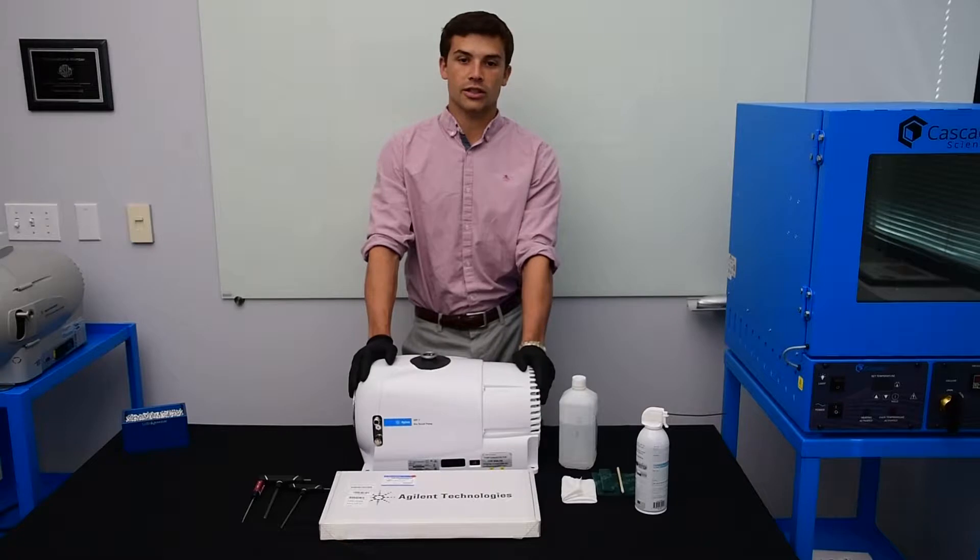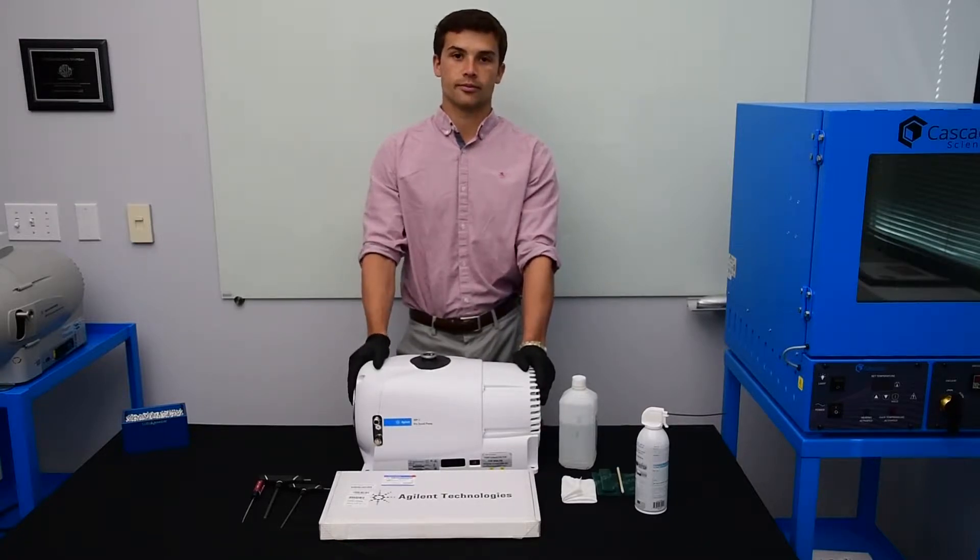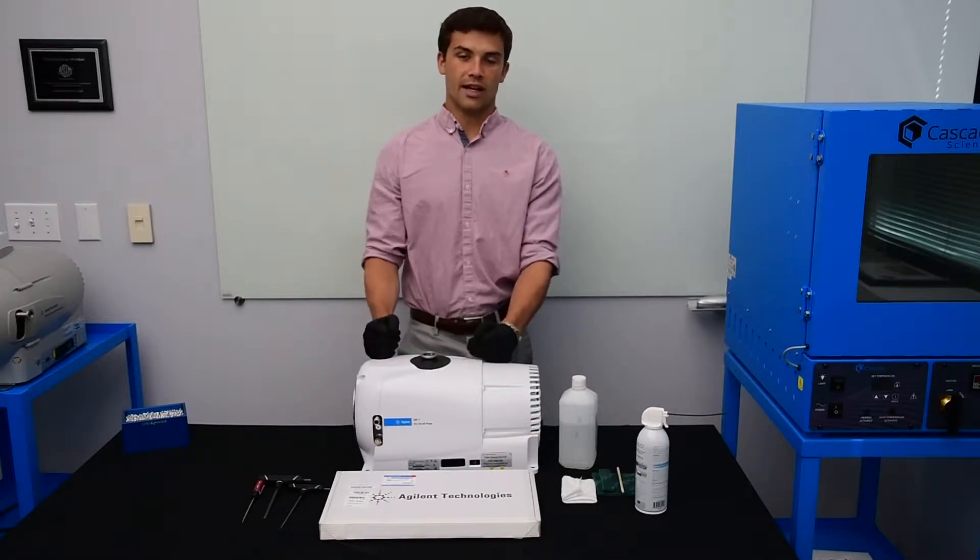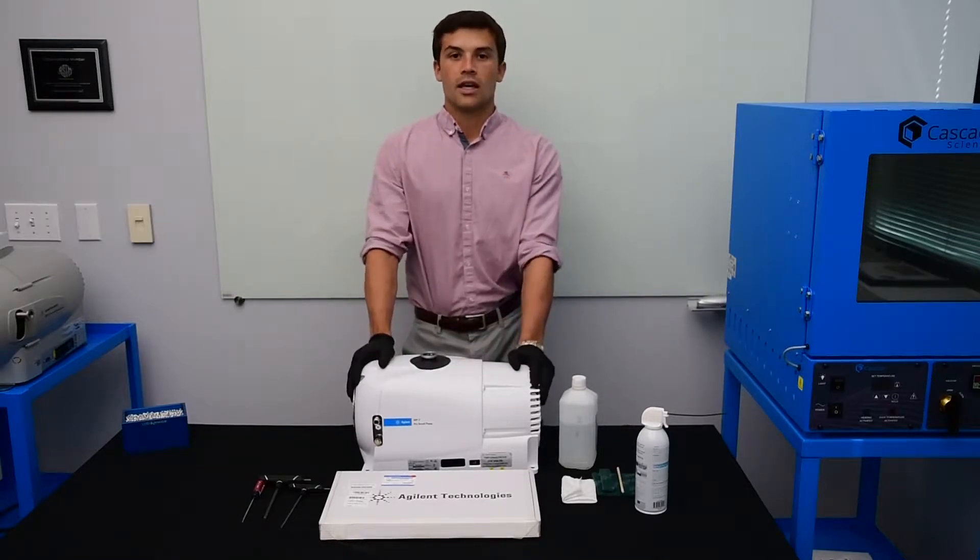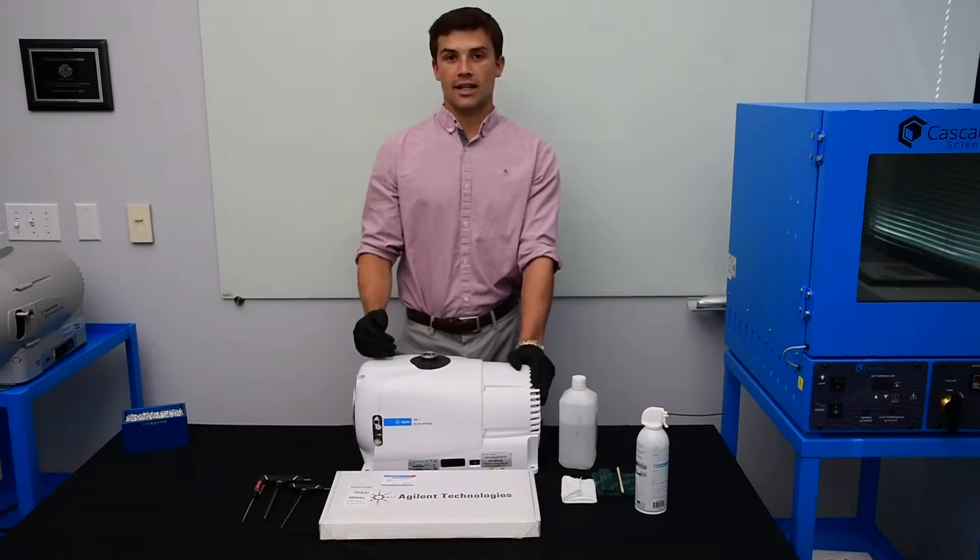In purge oven applications, you're going to get buildup or residue in your scroll pump. It's necessary to take a pump offline for a brief amount of time if you're experiencing longer pump downs or you're not getting to as deep vacuum.